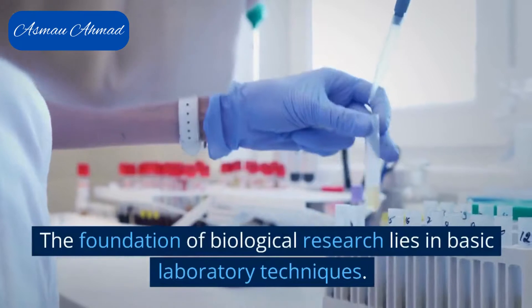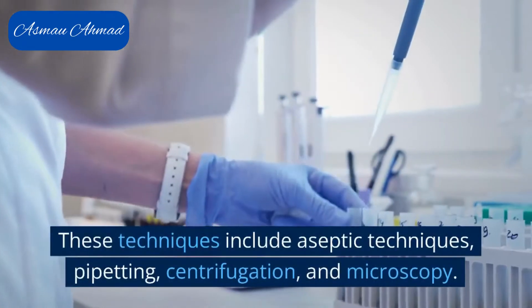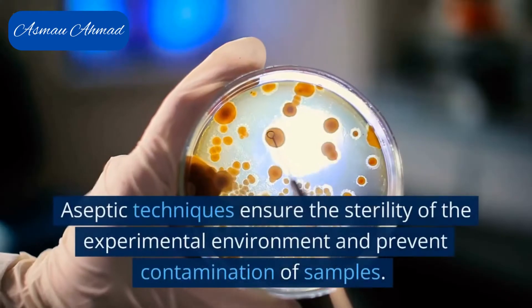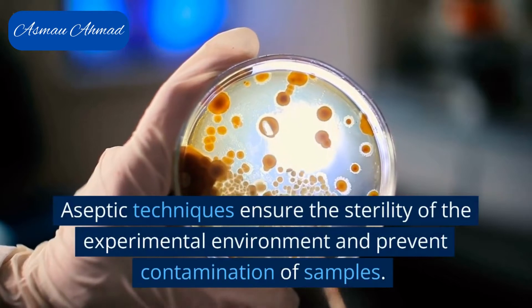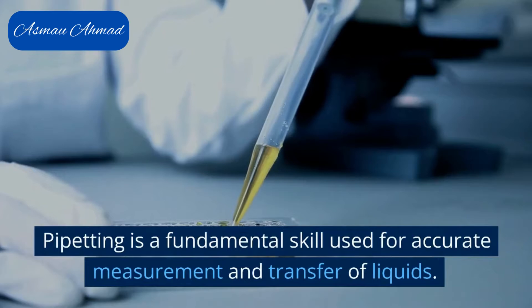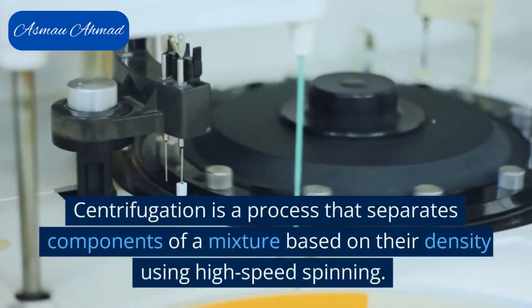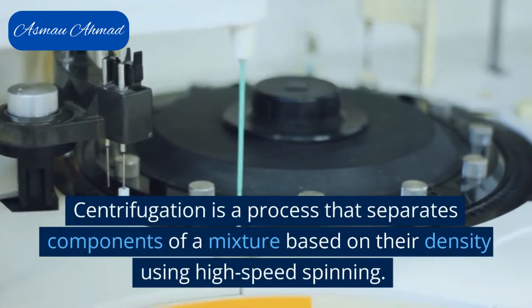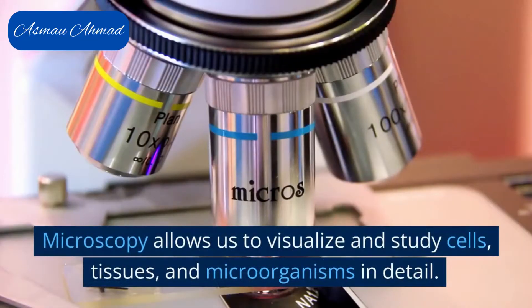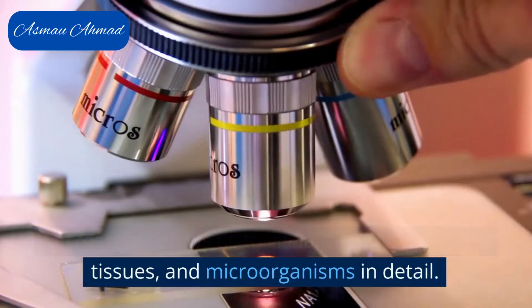The foundation of biological research lies in basic laboratory techniques. These techniques include aseptic techniques, pipetting, centrifugation, and microscopy. Aseptic techniques ensure the sterility of the experimental environment and prevent contamination of samples. Pipetting is a fundamental skill used for accurate measurement and transfer of liquids. Centrifugation separates components of a mixture based on their density using high-speed spinning. Microscopy allows us to visualize and study cells, tissues, and microorganisms in detail.